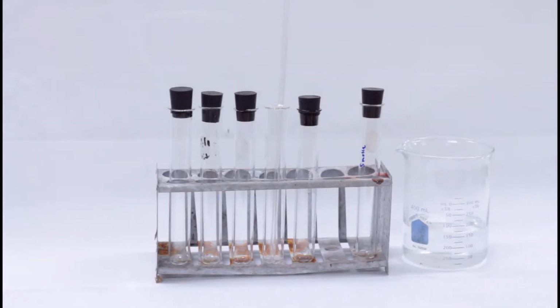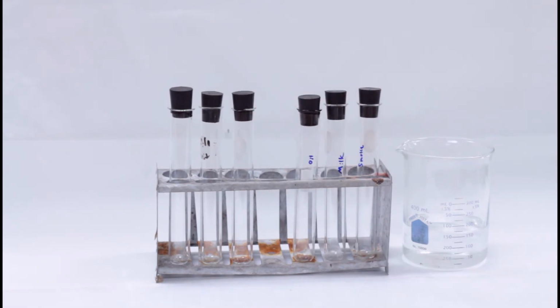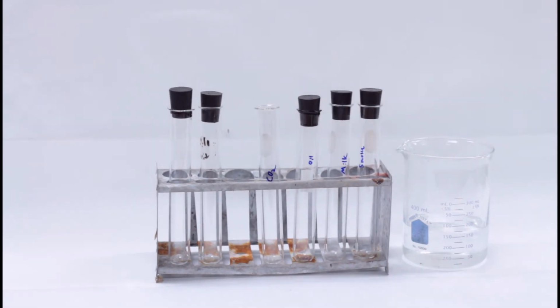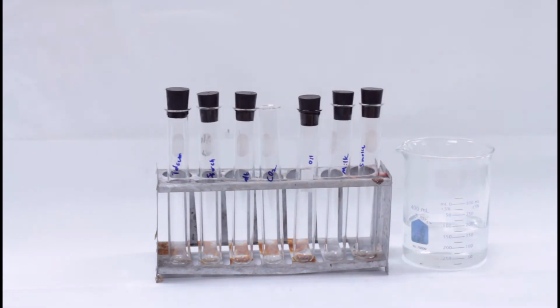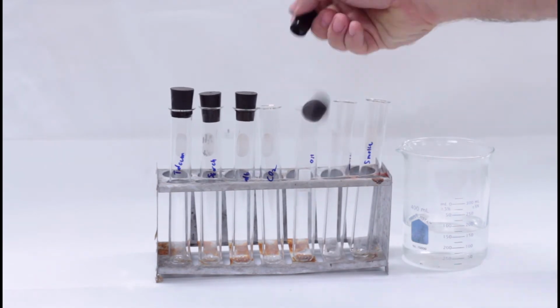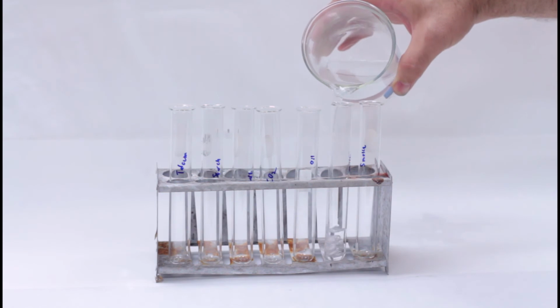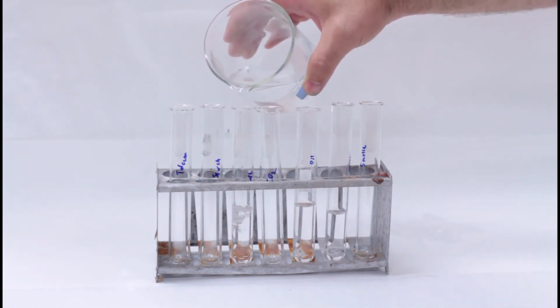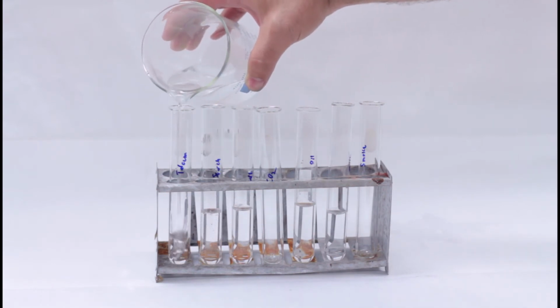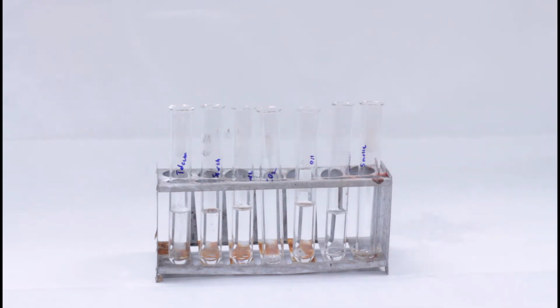For our procedure, first, label each test tube with what will be put in it. Label the club soda test tube with CO2 because we're really just concerned about the carbon dioxide. Our second step is fill 5 of the test tubes up about halfway with the water. The test tube that will have the club soda should be empty, and the test tube for the incense should be empty. Step 3. Pour talcum powder, starch, and salt in their respective labeled test tubes.